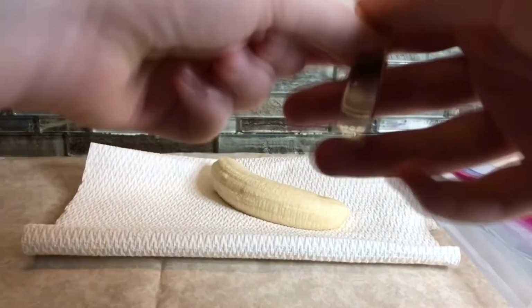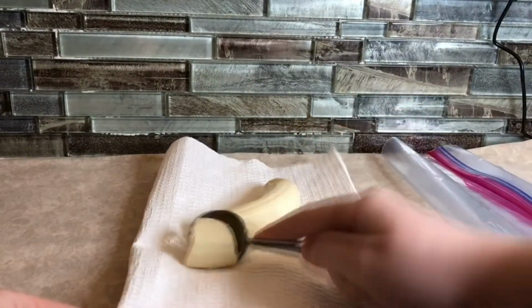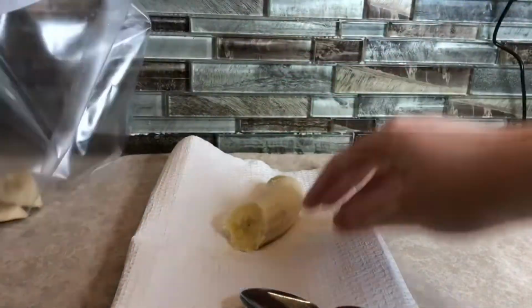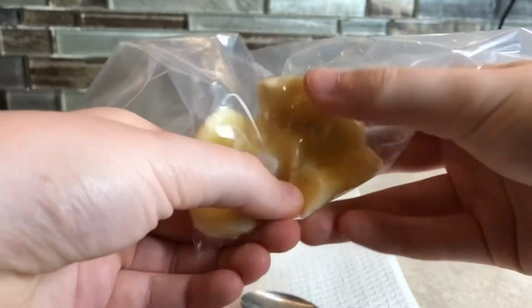So first, you're going to want to place the bottle of rubbing alcohol into the refrigerator because it won't be needed until step 9. Next, cut off a portion of the peeled banana. I cut off like a 1.5-inch portion of the banana from the end. Once it's cut, place the banana into the bag. Move the banana piece into the corner of the bag, seal the bag, and then mash the piece up smoothly. Make sure there are no chunks left.